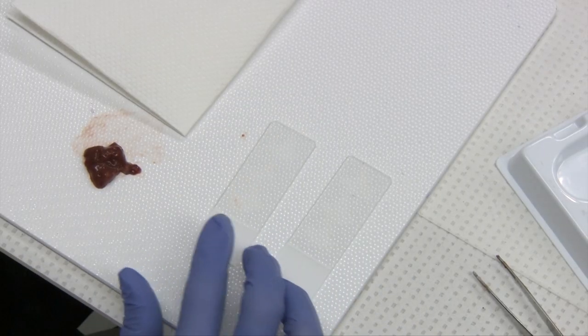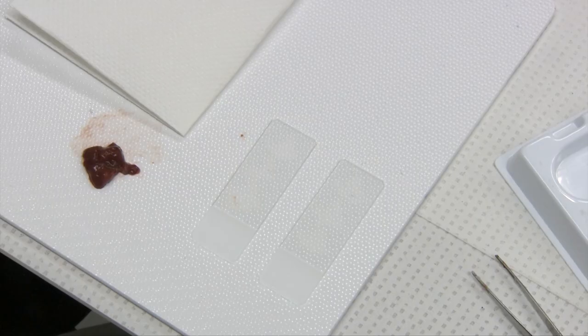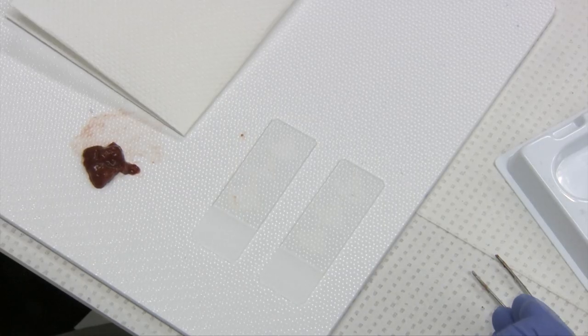Then these slides can be air dried and labeled with a pencil, labeling with the patient information and the site, packaged into a slide protector and submitted to a diagnostic laboratory.